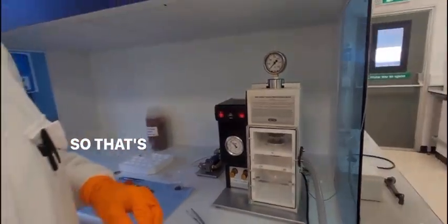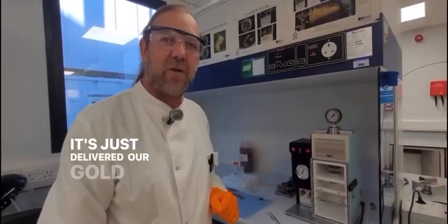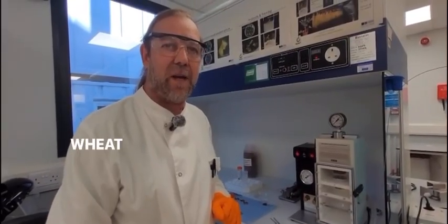So that's our gene gun. It's just delivered our gold particles and DNA into our wheat embryos.